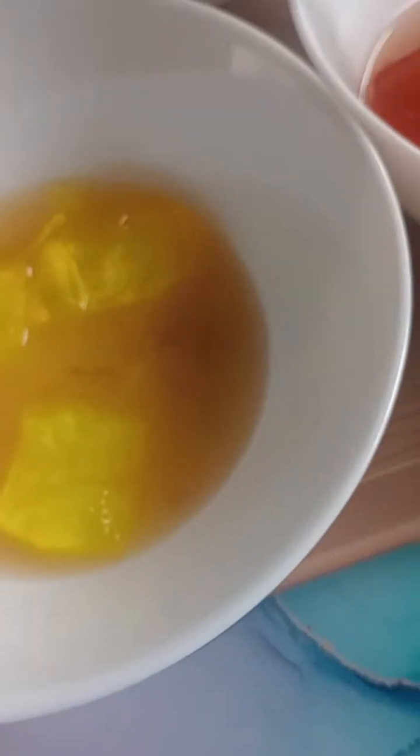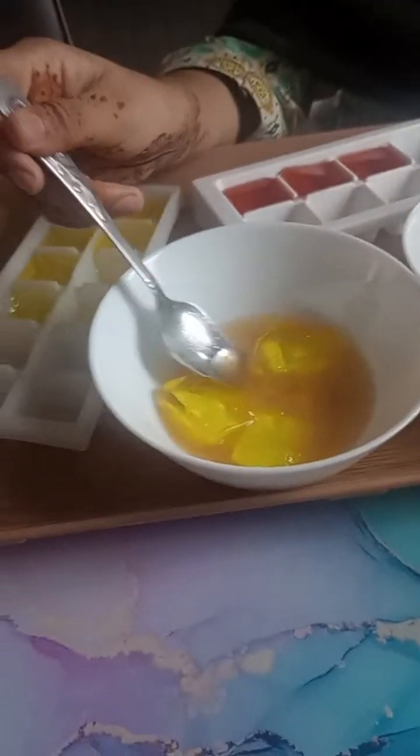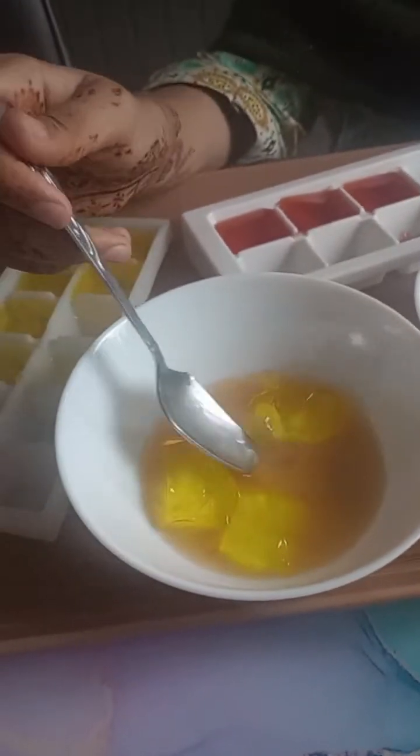So there you go. If you can see, if I can put the camera towards up, it does take longer to reach the center, which could slow down life processes. So in biology, size really does matter, especially when it comes to diffusion.